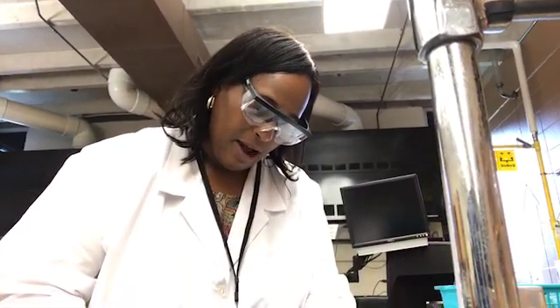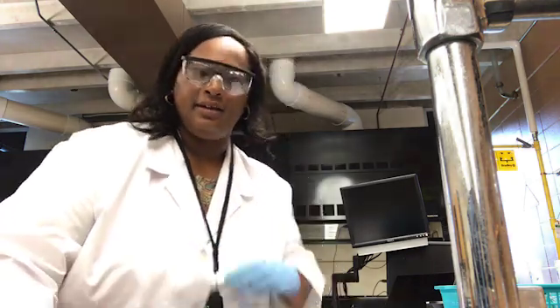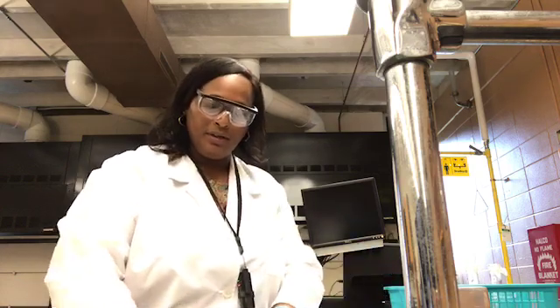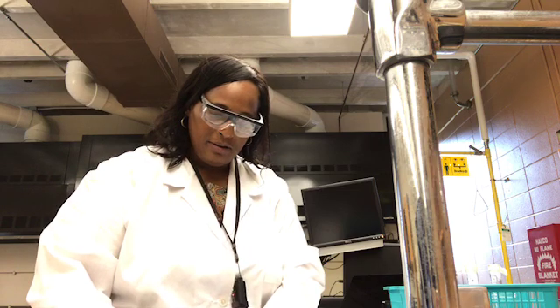We'll line up our ruler so that the line at the edge of the ruler, which starts the measurement part of the ruler, is flush with the end of the metal block.